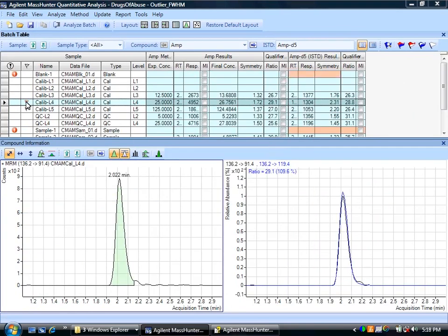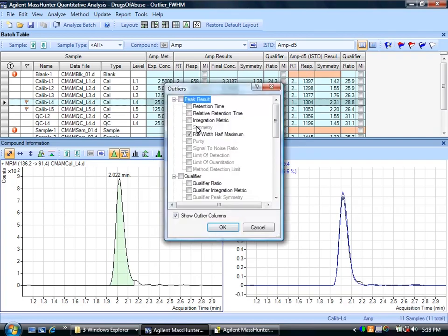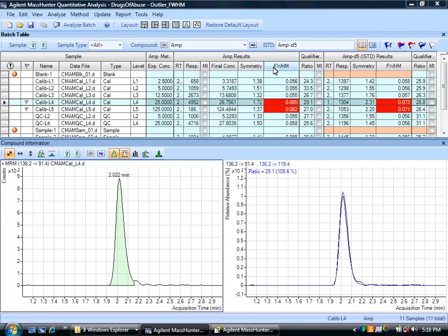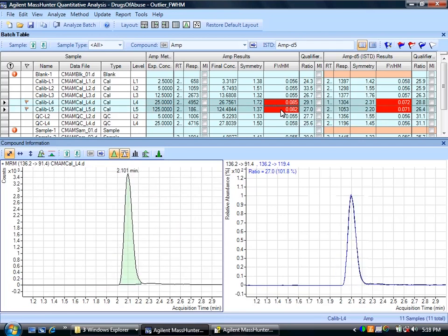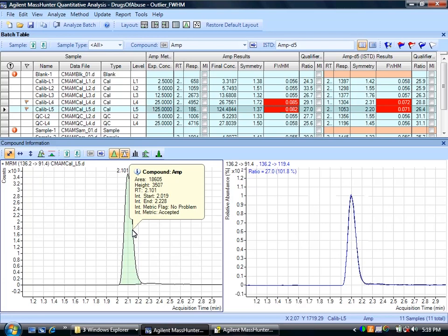We'll see that a couple of outliers have shown up here. What I will do next is turn the presentation on for the outliers. So I see here's full width half height maximum, and I will show the outlier columns. That will add in this column, and let's look at calibration level 4 and level 5. If I look at these, I will see the peak is slightly wider. If I look closely, you can see there's a little bit extra on there, which has pushed these, especially since they're higher concentrations, to a wider half height at maximum here.